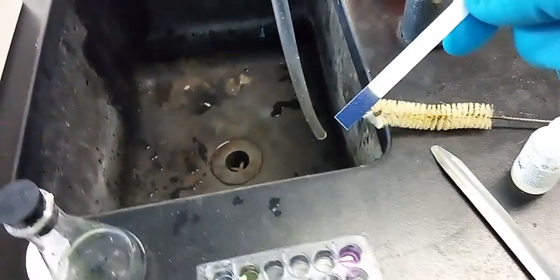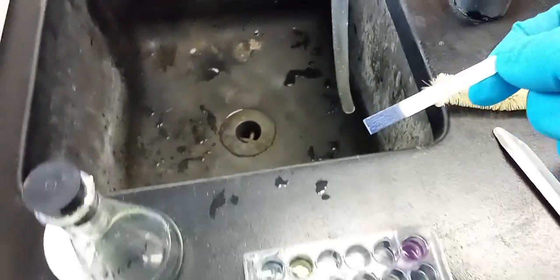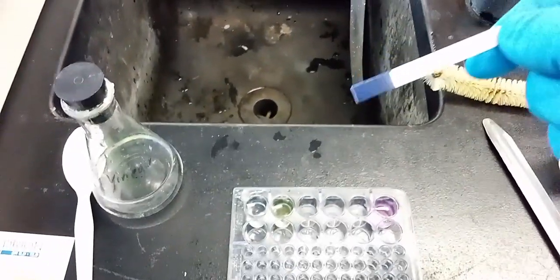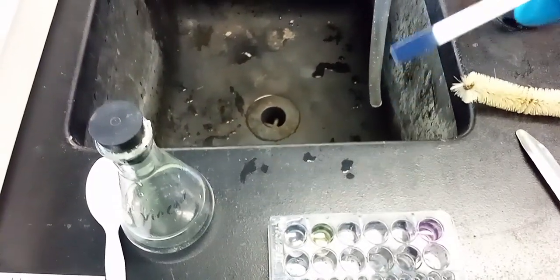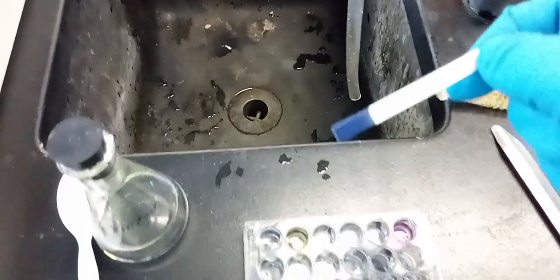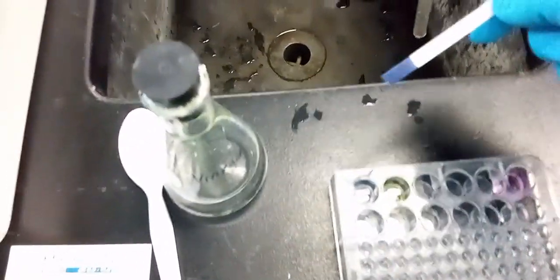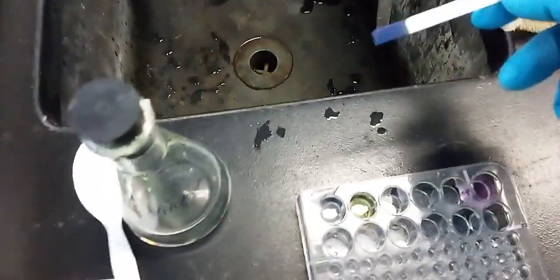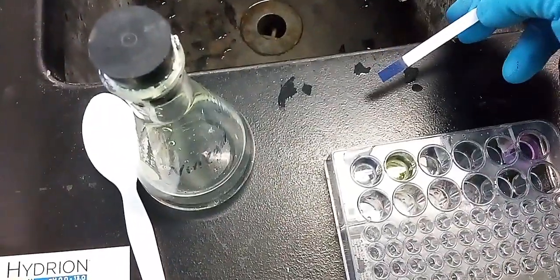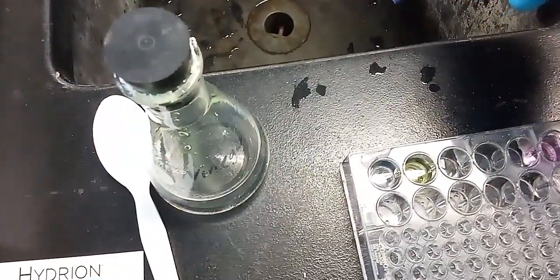This is also called potash, potassium hydroxide. It's also used to make soap. If you watch the movie Fight Club, there's a scene in there where a chemical burn happened. I'm afraid of using this. I'm wearing gloves. You can see that I'm using protective equipment because this is not something that I want to touch myself, because it's really caustic.